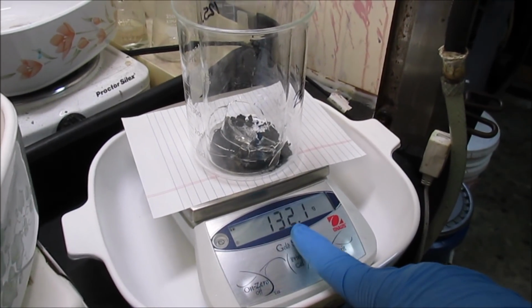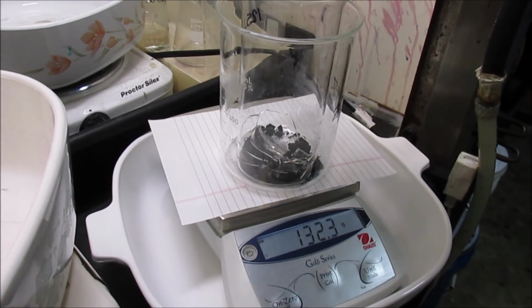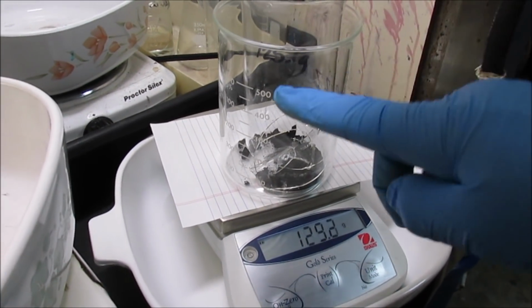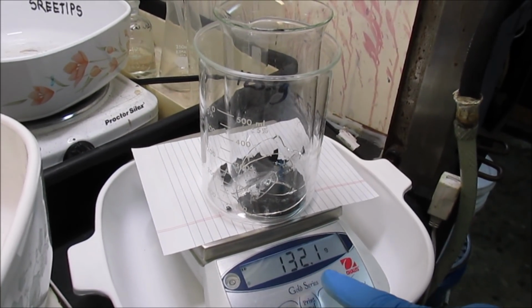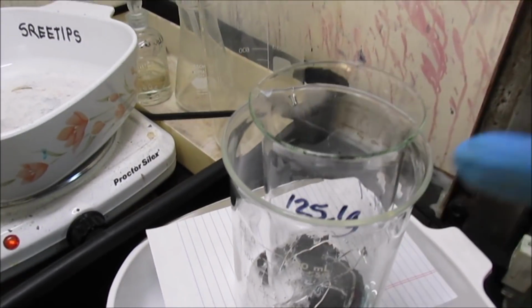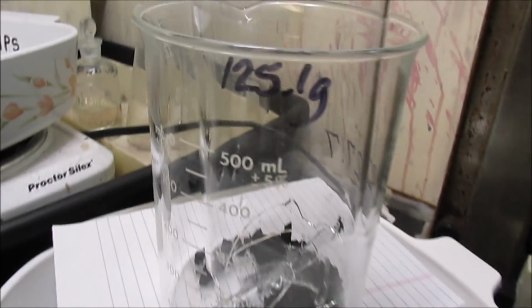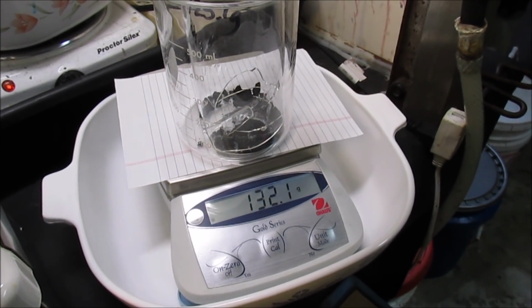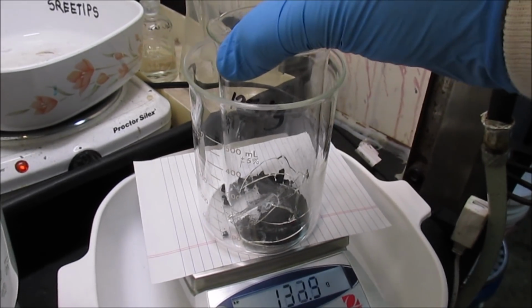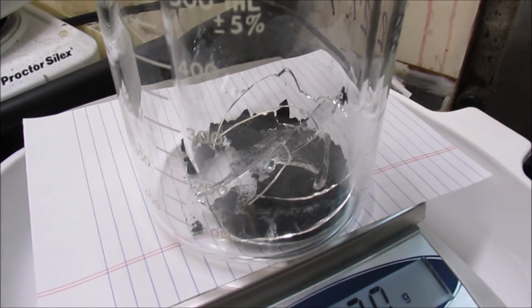Alright, I've got 132.1. The beaker up here was 125.1. So 132.1 minus 125.1. See it there? That means I've got exactly 7 grams of mixed PGM black powders in there.